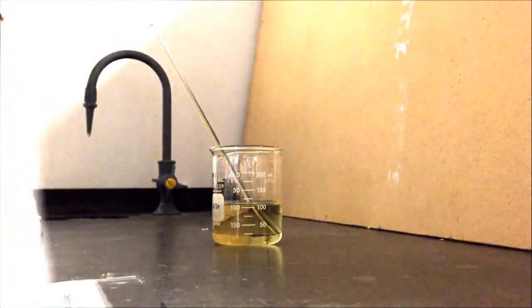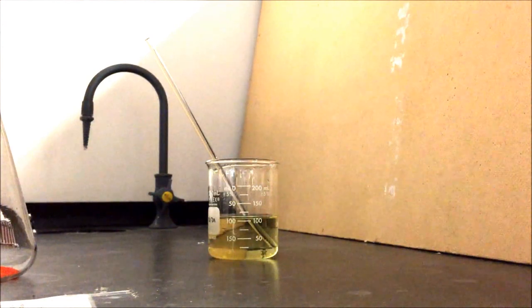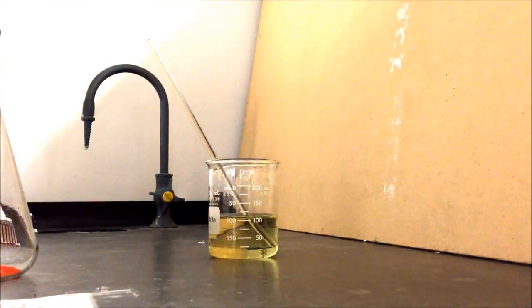Go ahead and begin stirring the solution. Okay, who wants to help me with this, guys?